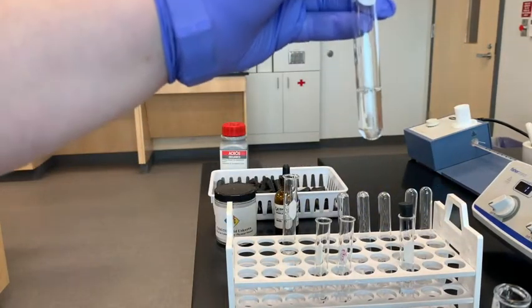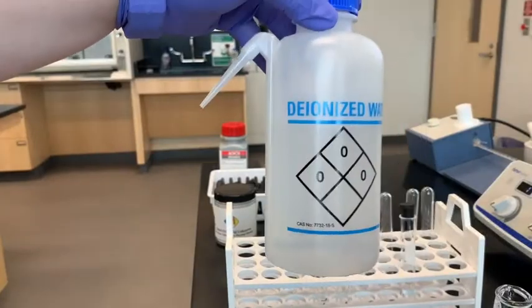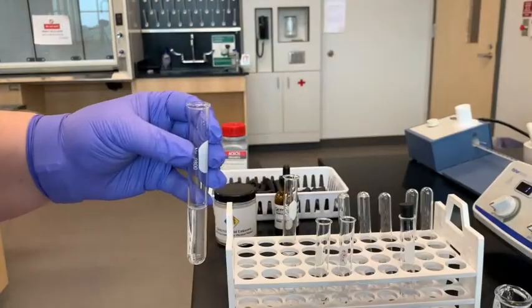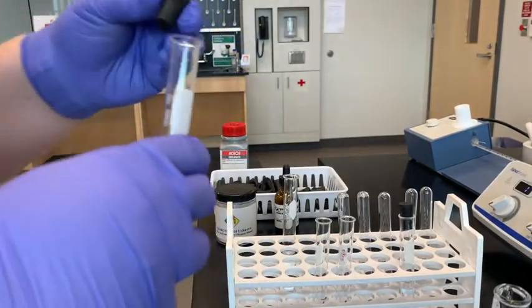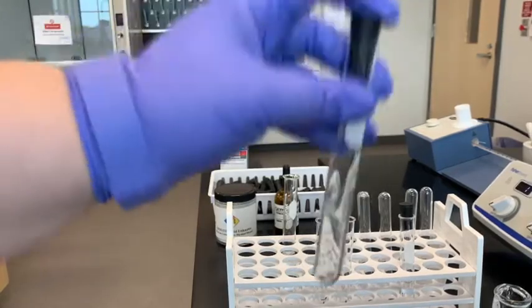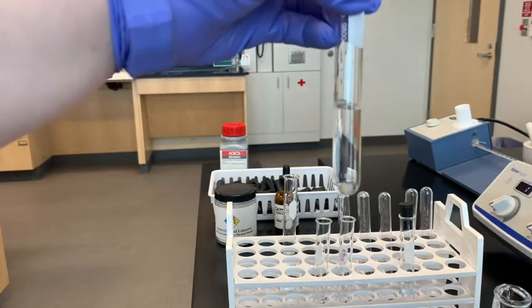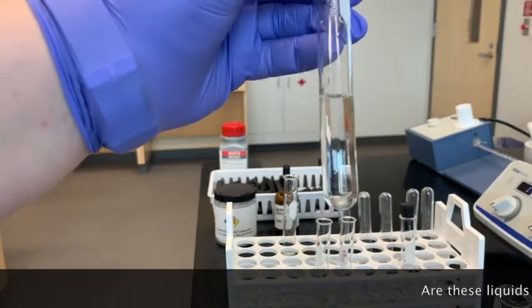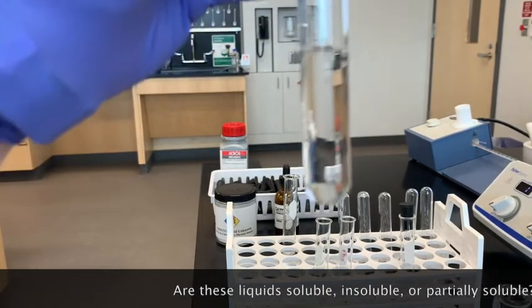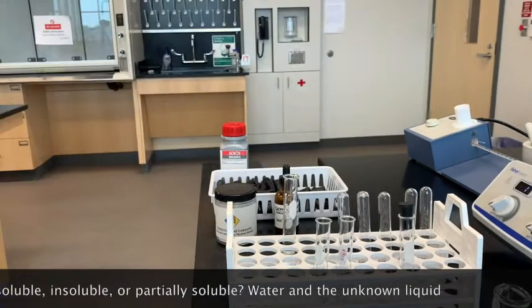Moving on to the solubility of our unknown liquid again — this time we're going to use distilled water. I'm going to add some distilled water, put the stopper in, and shake it up to see what the solubility is. There's a place on your report sheet to record your solubilities. Now I have water and the unknown liquid, and you can decide if it's soluble, insoluble, or partially soluble.